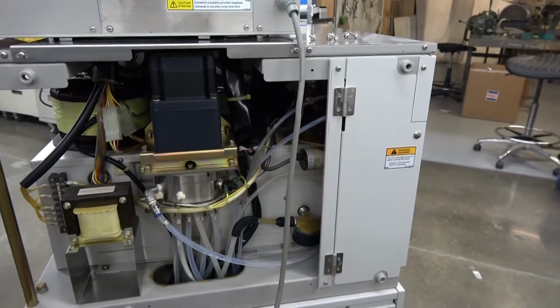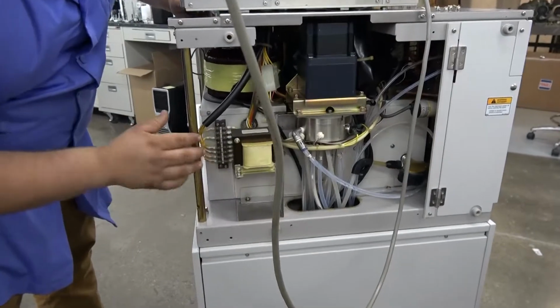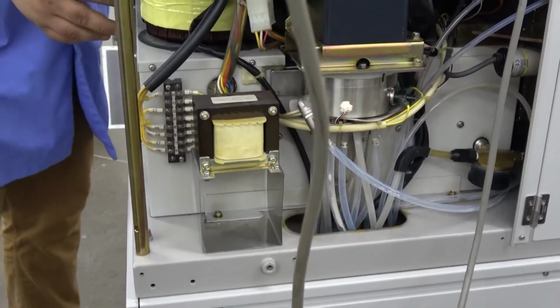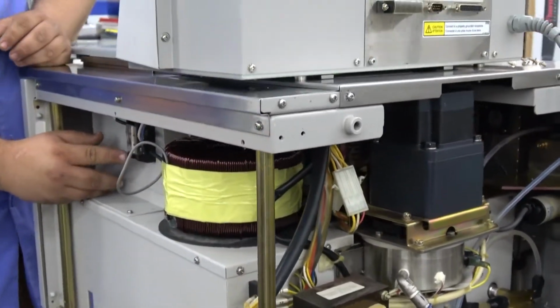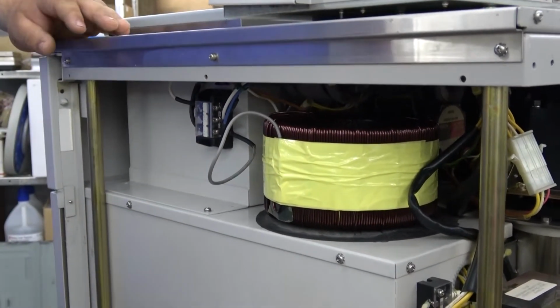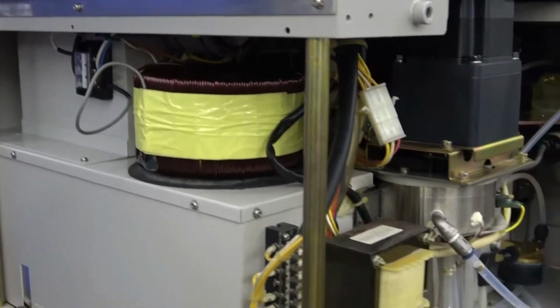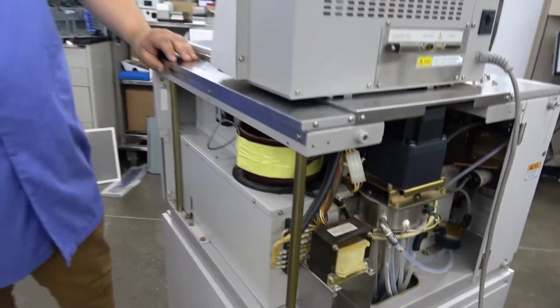So, what we've done is built this little platform to put your factory transformer on, and then added this transformer here on top, and even put a little substation type electrical box in to make sure all the connections are clean and no shorts happen. Yeah, short free. This was so somebody could run this on 110 wall outlet instead of 220.